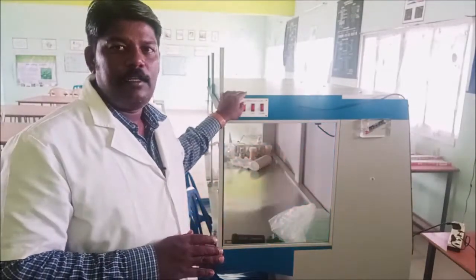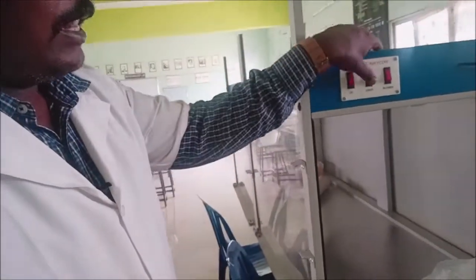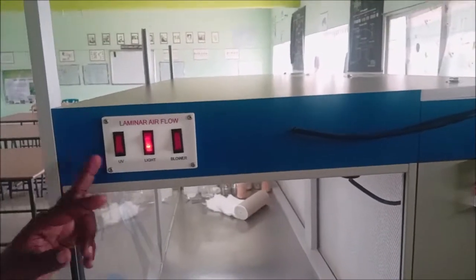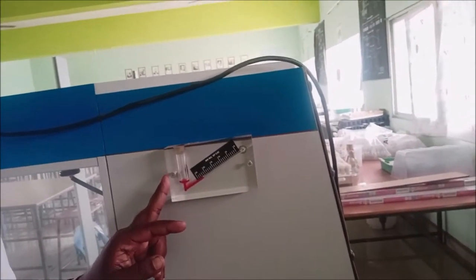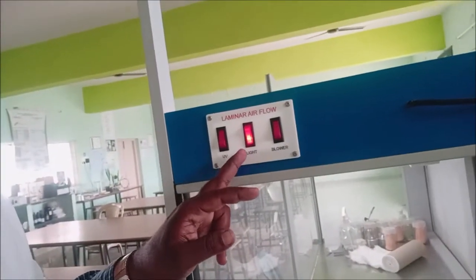After that, before working, you need to switch on the working light. The components of the laminar air flow chamber are: the ultraviolet light, the working light, and the blower. The blower maintains wind velocity and air pressure inside the chamber.